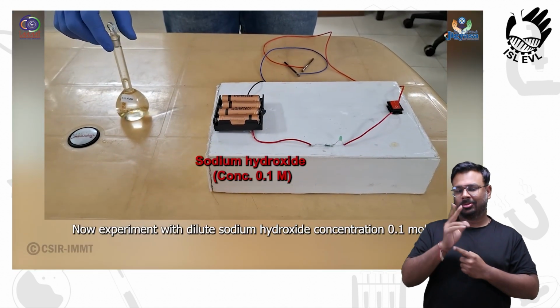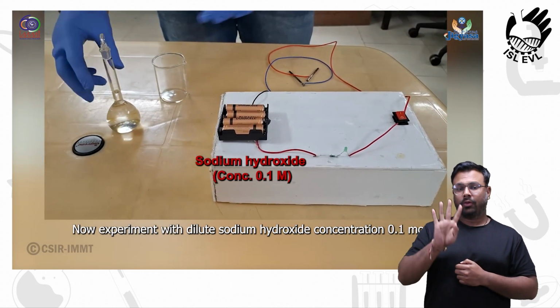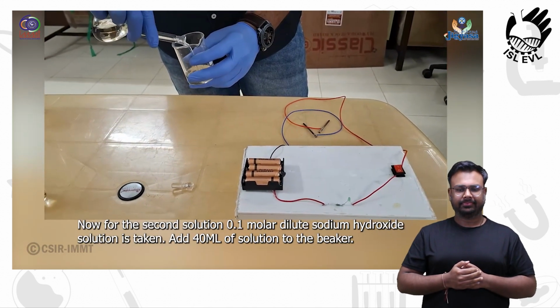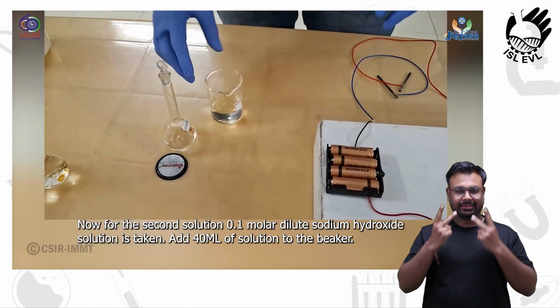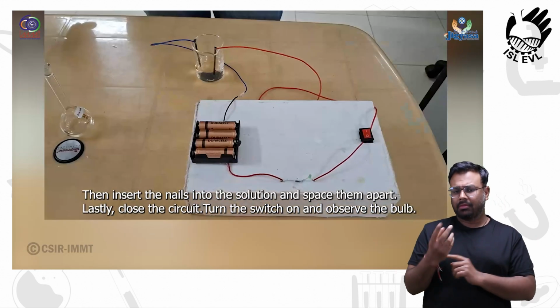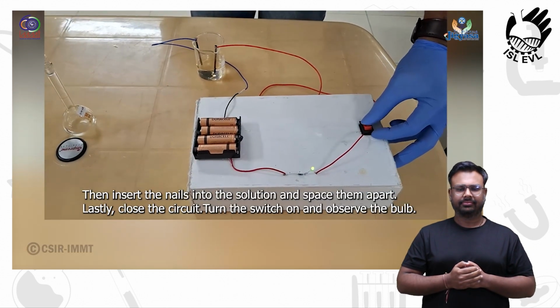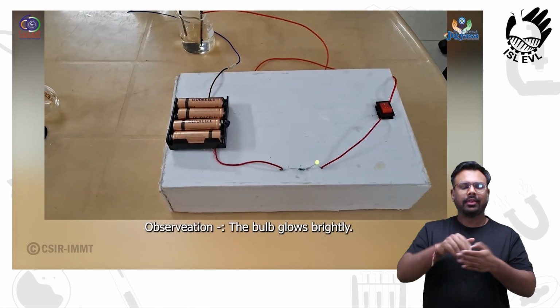Now experiment with dilute sodium hydroxide. Concentration 0.1 molar. Now for the second solution, 0.1 molar dilute sodium hydroxide solution is taken. Add 40 ml of solution to the beaker. Then insert the nails into the solution and space them apart. Lastly, close the circuit, turn the switch on and observe the bulbs. Observation: the bulb glows brightly.